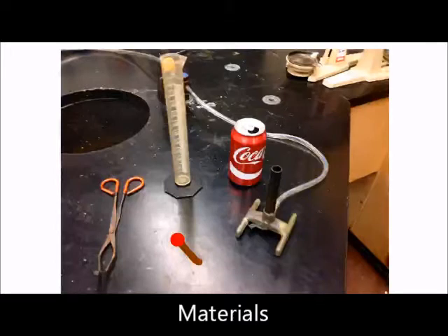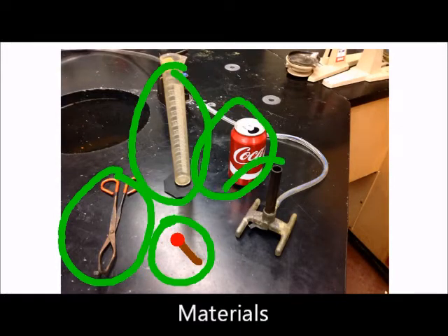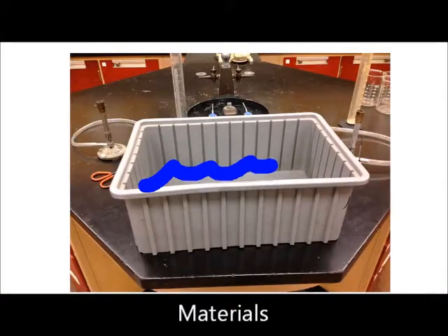The materials needed for our lab are tongs, matches, a graduated cylinder, a soda can, and a Bunsen burner. We are also going to need a tub full of water.